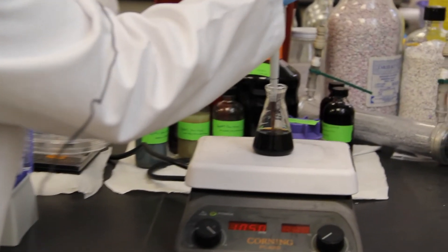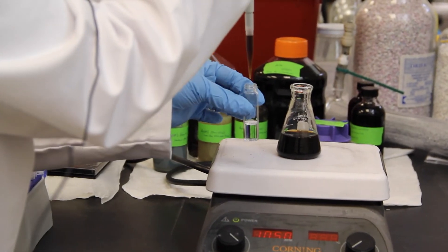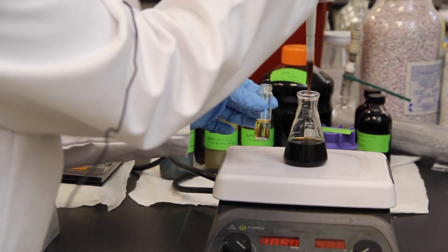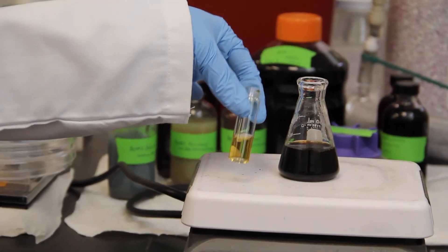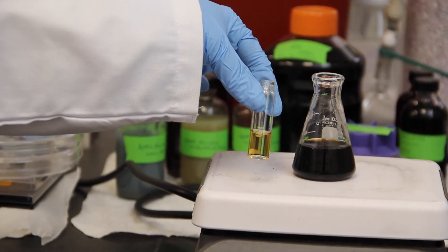If we dilute this brown colored suspension with water, then we see the characteristic yellow color of silver nanoparticles.